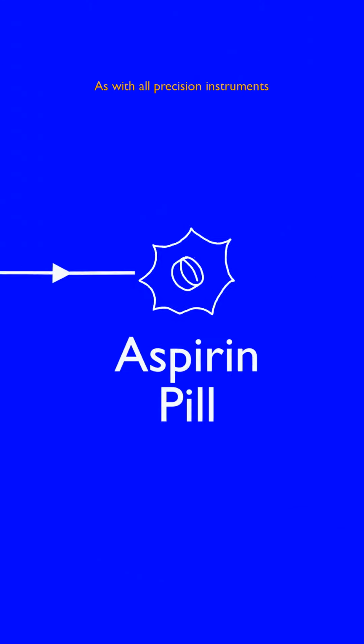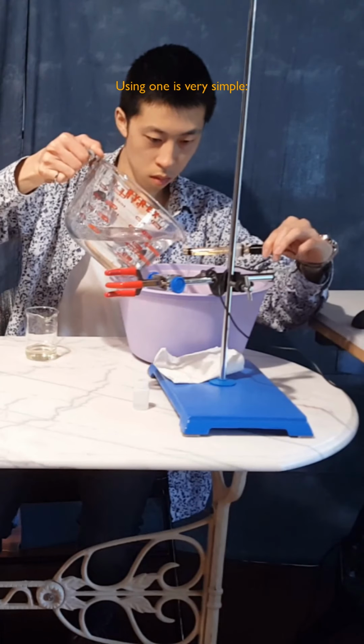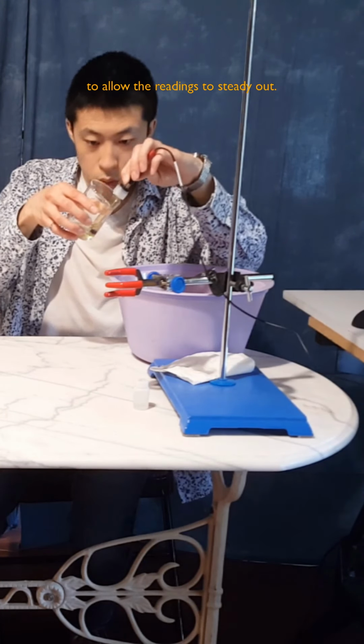As with all precision instruments, there's a trade-off between precision and noise. This video will show you some techniques I use to get the full potential from this powerful tool. Using one is very simple. Rinse your bulb with neutral water and pat dry after each new sample. Then, submerge in the sample for 2 minutes to allow the readings to steady out.